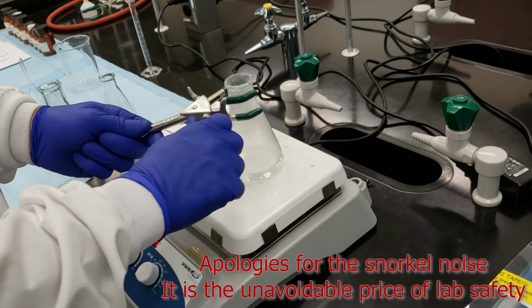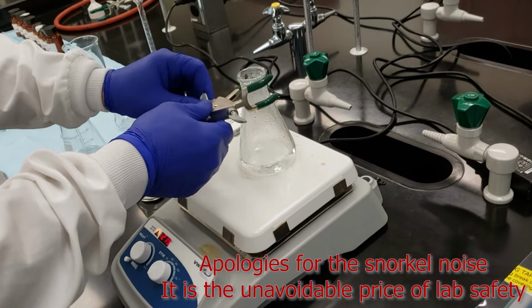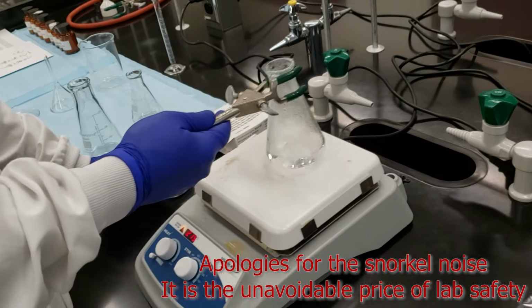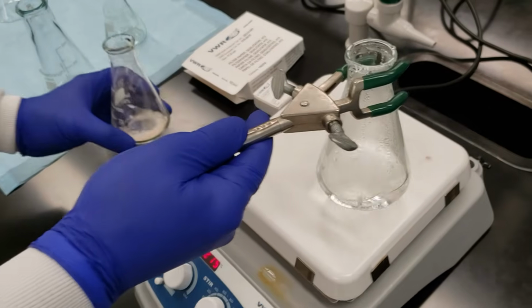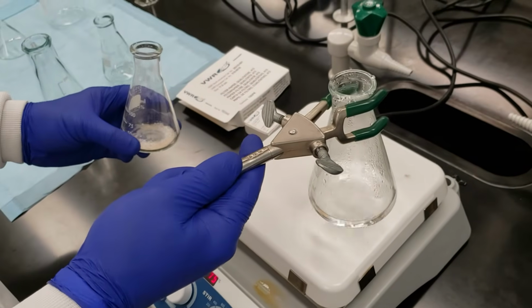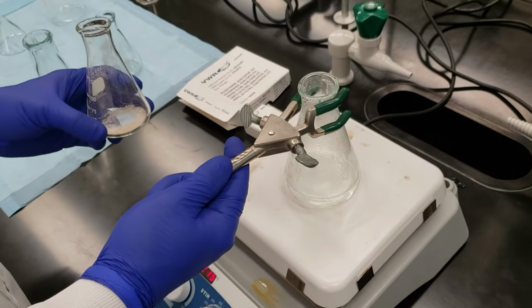I don't want to accidentally melt our compound before we've gotten it dissolved. Because the flask is hot, I'm going to use one of these three-pronged clamps to help me with pouring. And this is going to be a rough estimate of the amount of water that we're putting in.